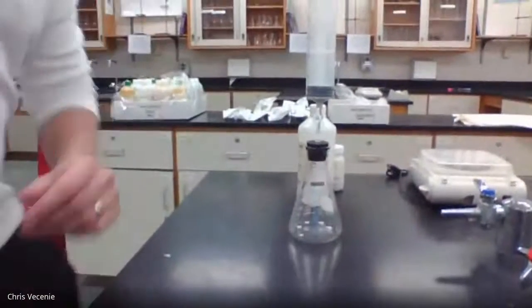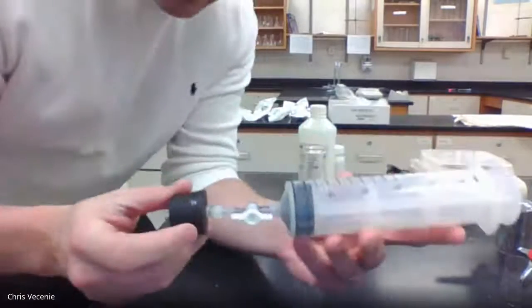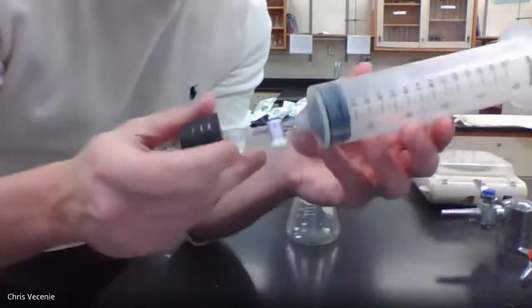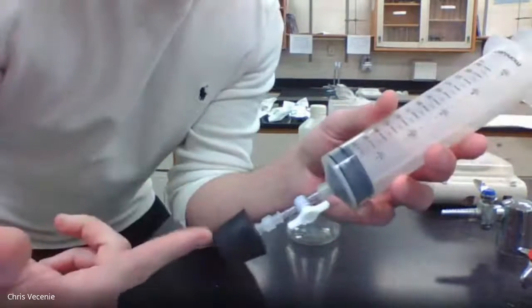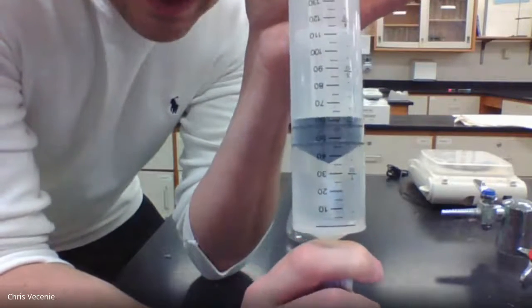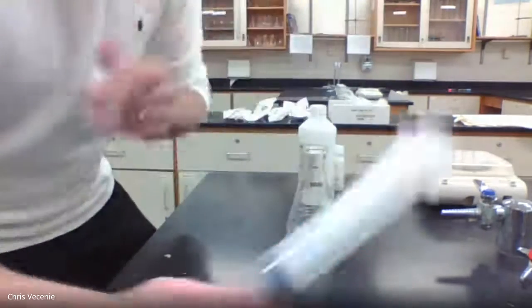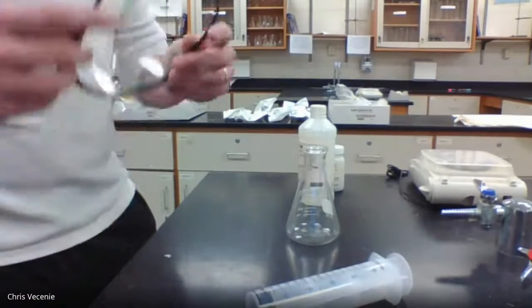All right, so here's my setup. I've got my syringe here. Notice I've got a stopper and it's got a valve on here. I would always tell you guys in class, make sure that valve, which is called the stopcock, is open, because we want to make sure that the gas can push up into here. When we start creating gas, it's going to push this cylinder piston up. The more gas you create, the further up it goes. And we're going to monitor what that is over a span of time.